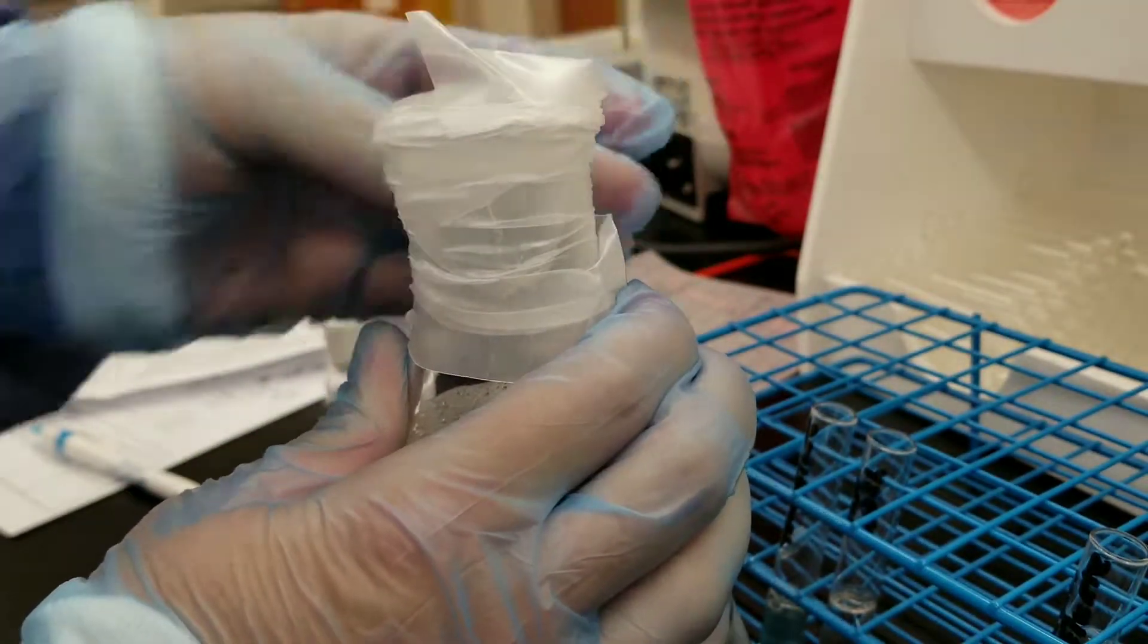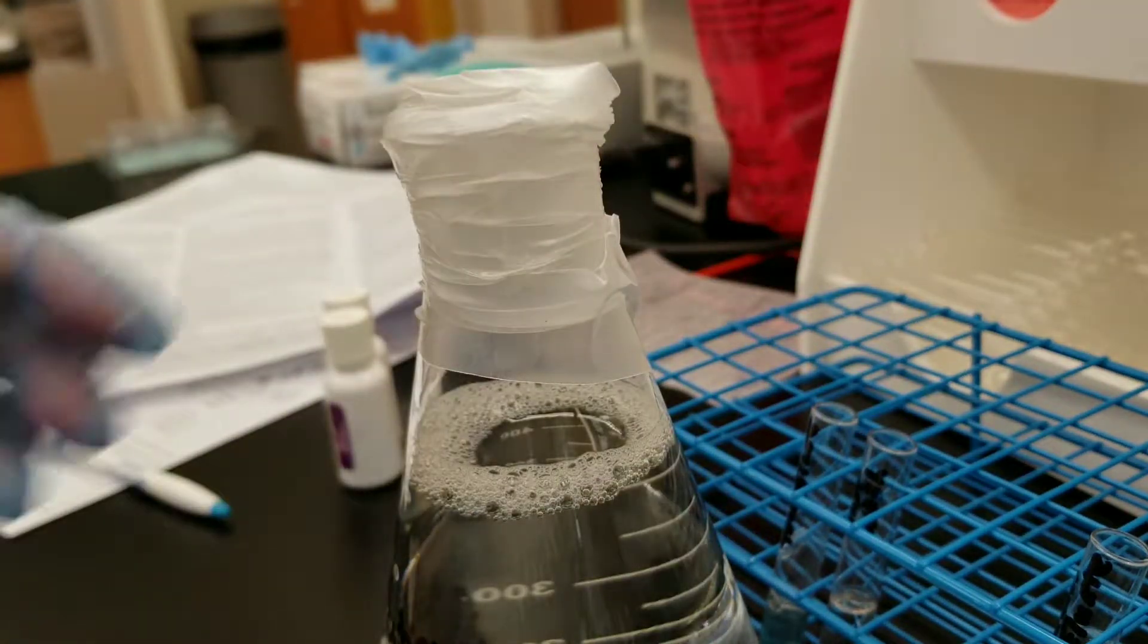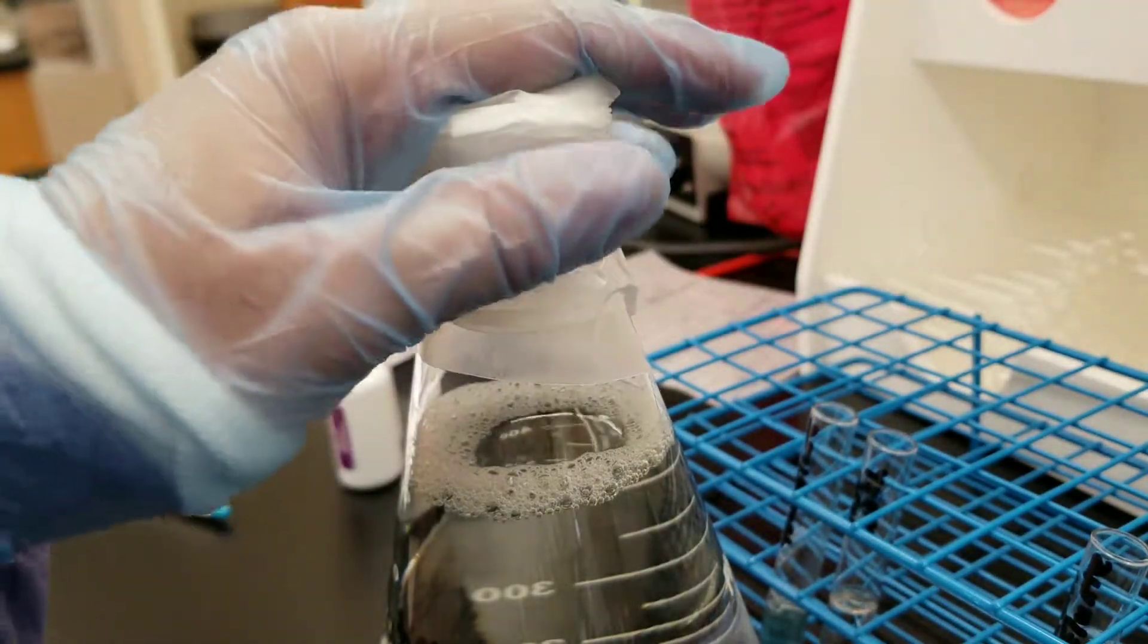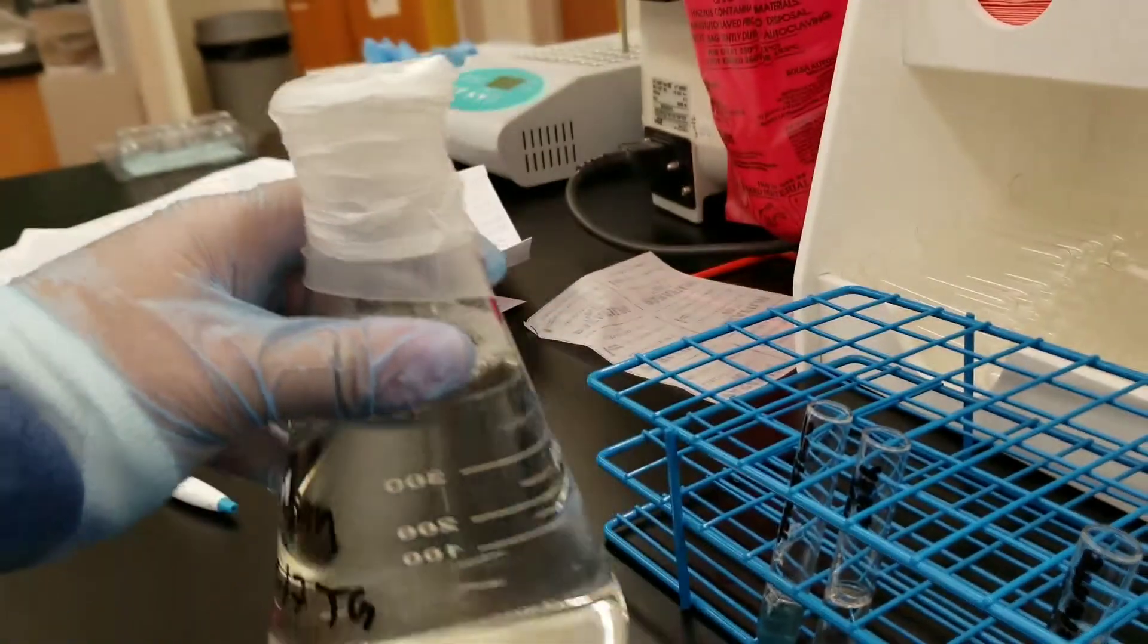This is not something that will hold if you turn it over and try to pour stuff out. Please don't do that, but it's basically more secure for splashing and that sort of thing.